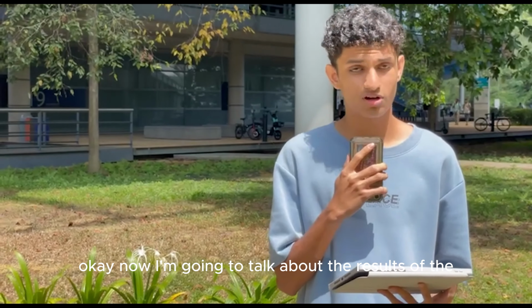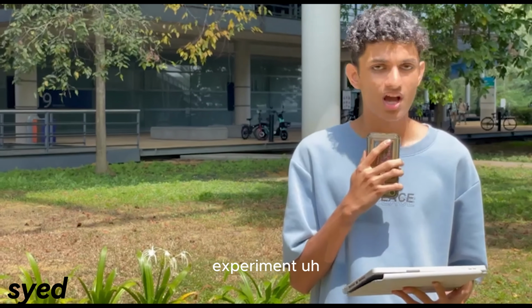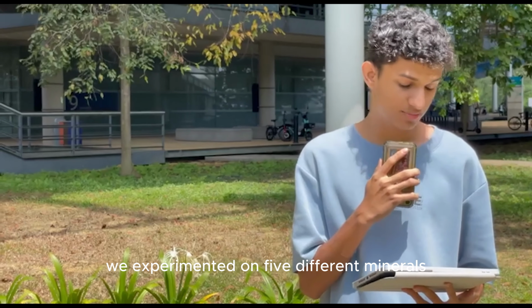Okay, now I'm going to talk about the results of the experiment. We experimented on 5 different minerals.